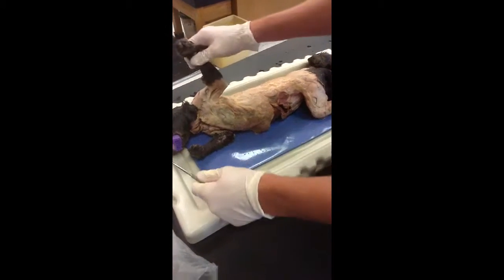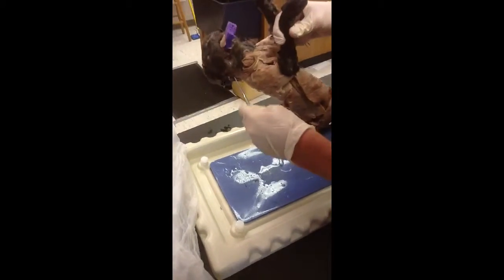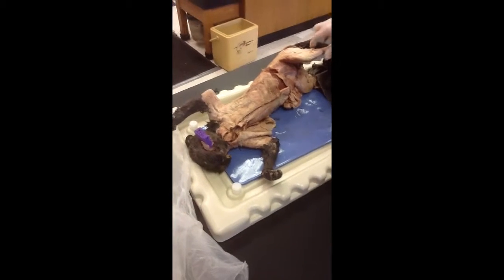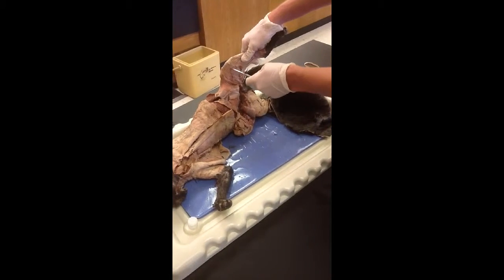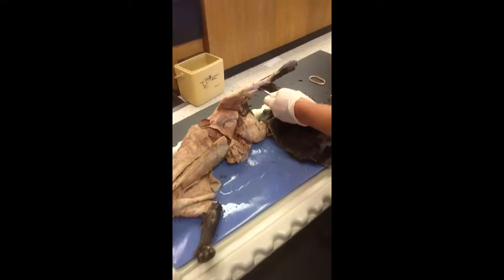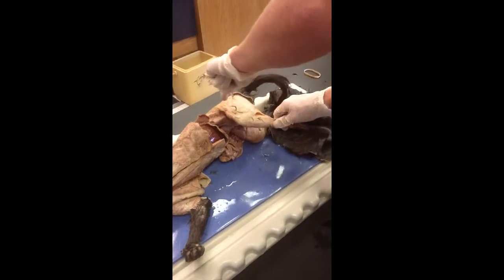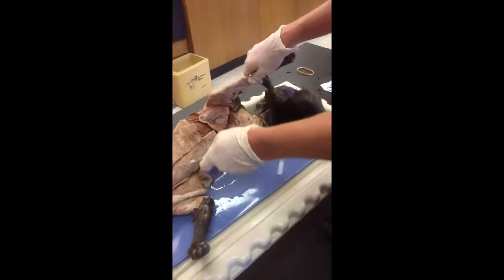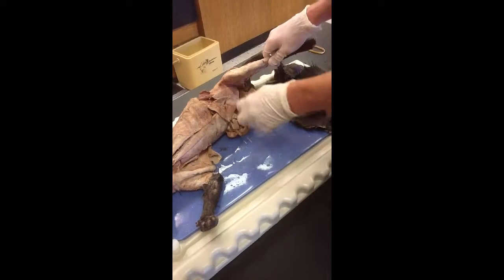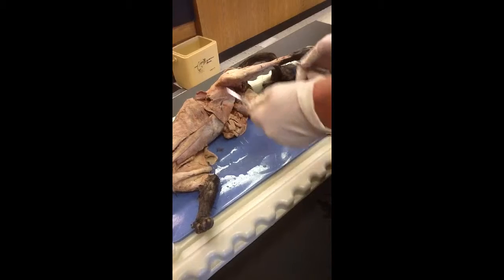The masseter is, of course, on the other side of the cat, which is right there. And then you have the sartorius, which is the upper part of the inside, and the gracilis, the Achilles tendon, or something or another. The gluteal muscles are at the top. The linea alba is the little line going down the abdominal muscles. And this is the rectus abdominis right here, this muscle. And I think that's about it.